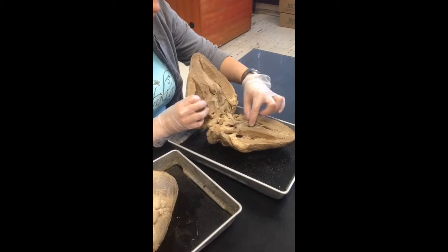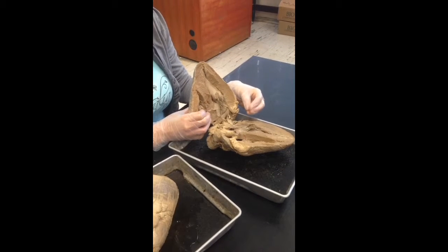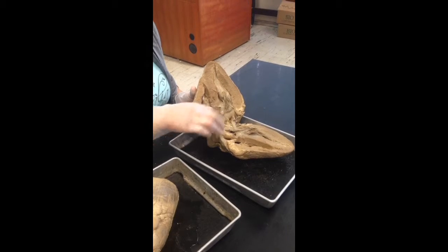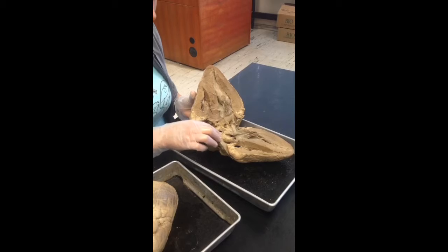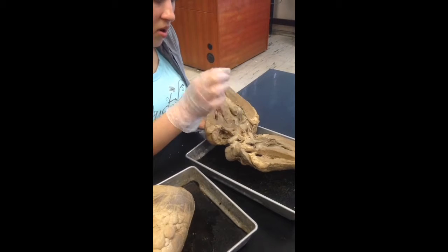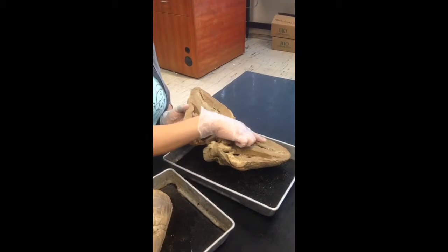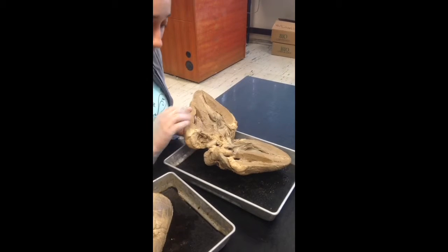Remember, the bicuspid and tricuspid valves are called atrioventricular valves. They're between atrium and ventricles. Atrium is singular. Atria is plural. You can see the papillary muscle really good right here. Okay, so wherever the pin is, just look, is it above or below the valve? Is the muscle thick or thinner on the side to tell left and right and top and bottom?